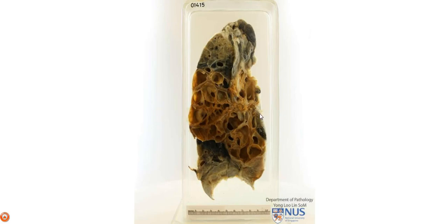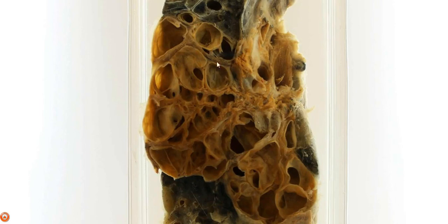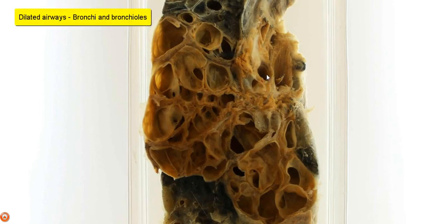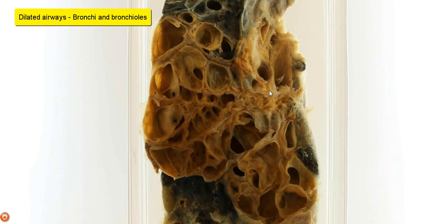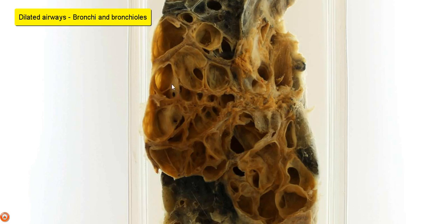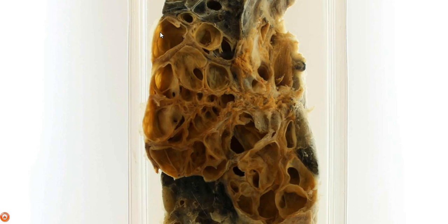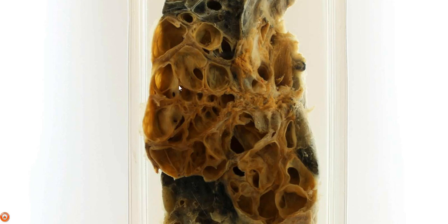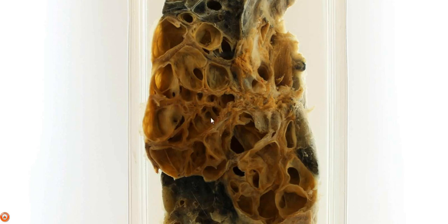It's got a very abnormal cut surface, and this shows multiple dilated airways. More centrally, closer to the hilar region, these are dilated bronchi, and then as we move more peripherally, some of these will be bronchioles. You can see that they go all the way to the pleural surface, which is very abnormal for bronchiolar spaces. Normally, we don't see them extending beyond about 2 to 3 cm from the pleural surface.